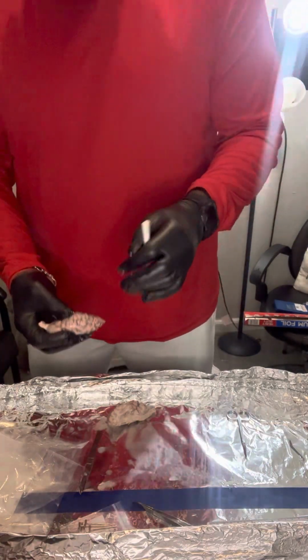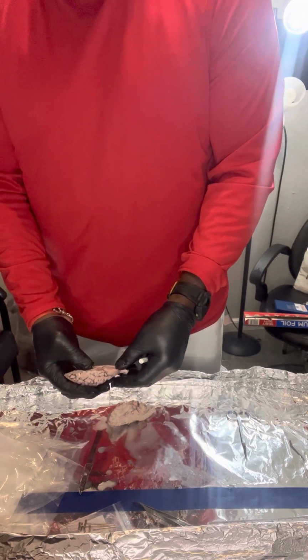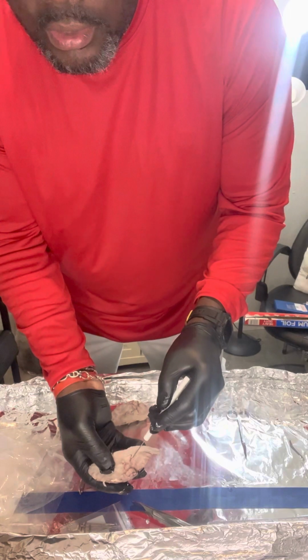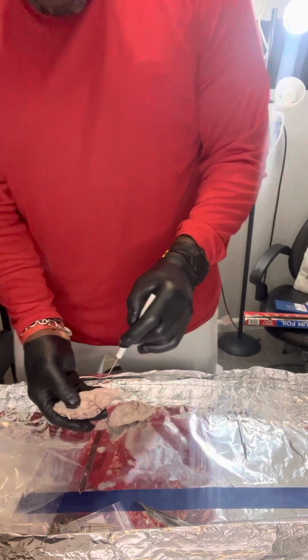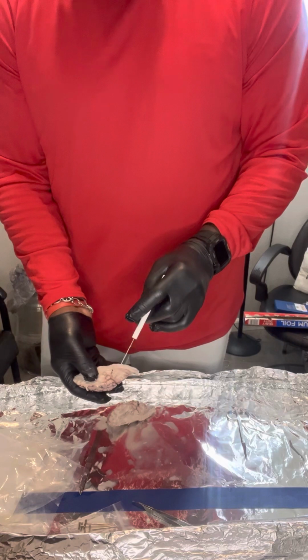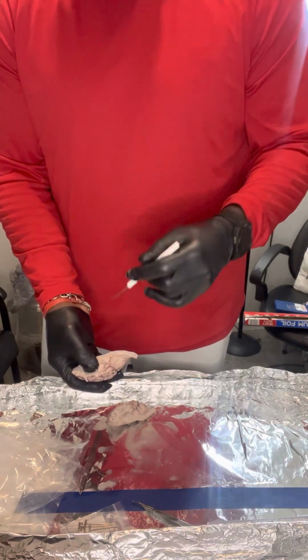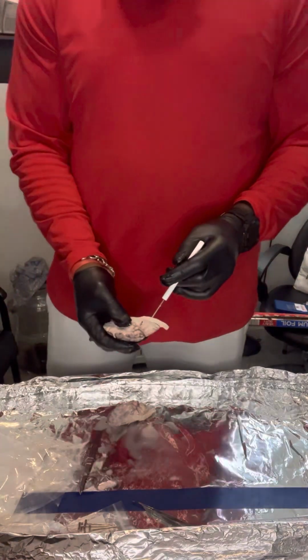Okay, the superior colliculus. Let me see which one shows it up the best. I think I've got it right here, actually. Yep, right in here. If you can see closely here, it's neighboring just about to the cerebellum. It's a multisensory midbrain structure, basically, that integrates the visual and auditory information that initiates orientation and movement of the eyes and head. So it brings it all together and makes it all make sense.